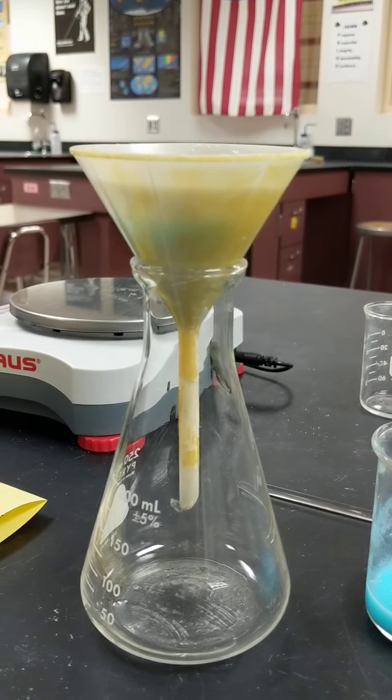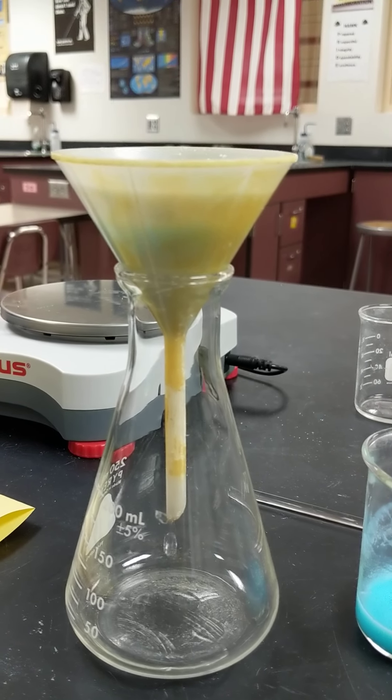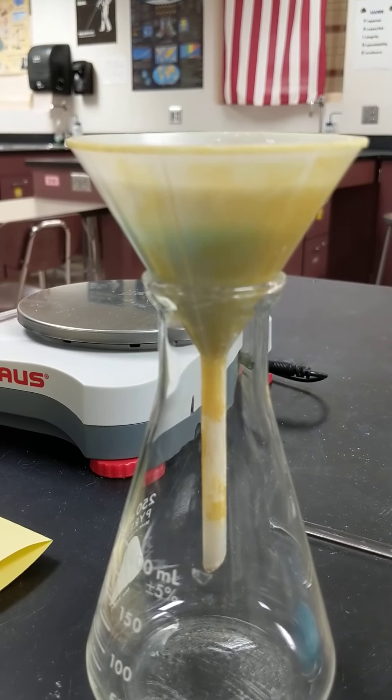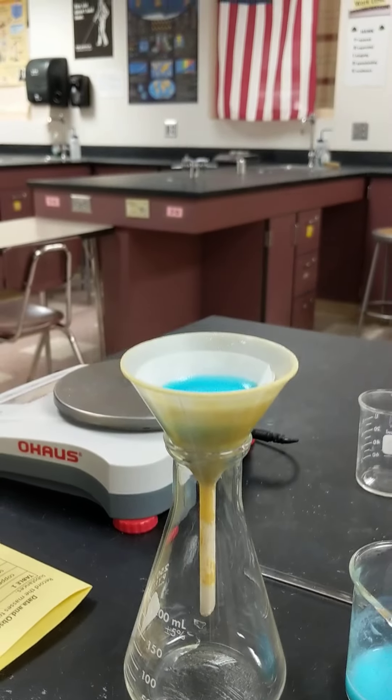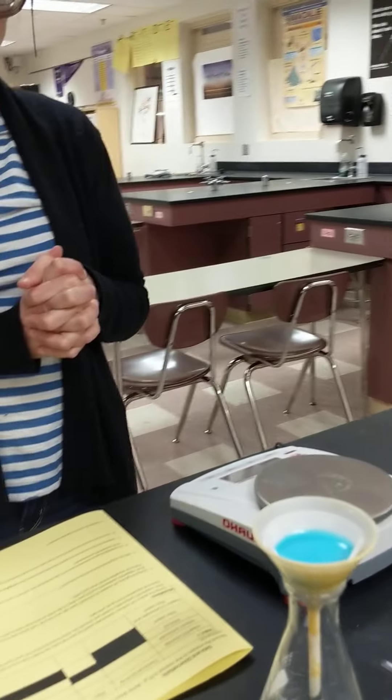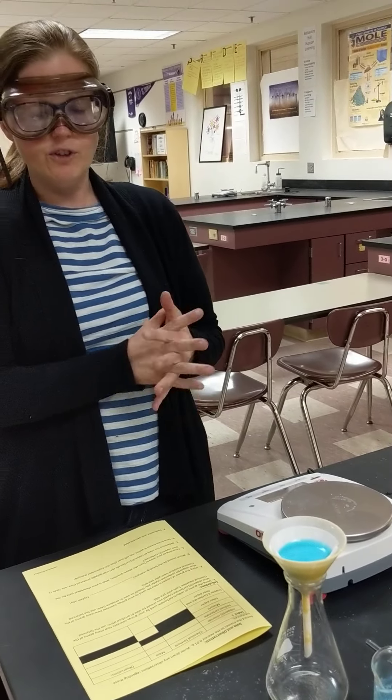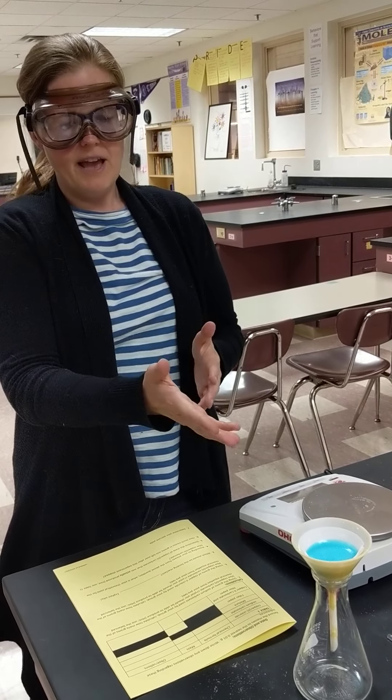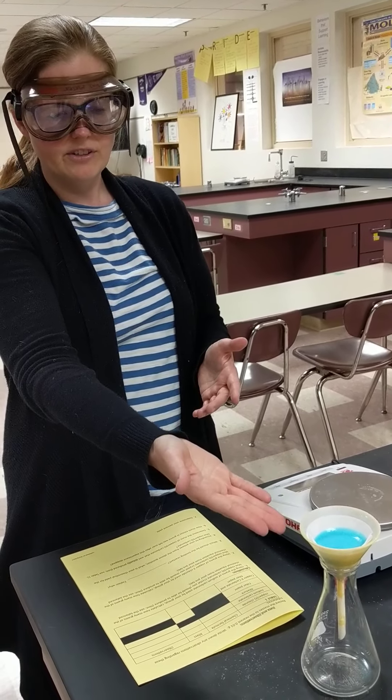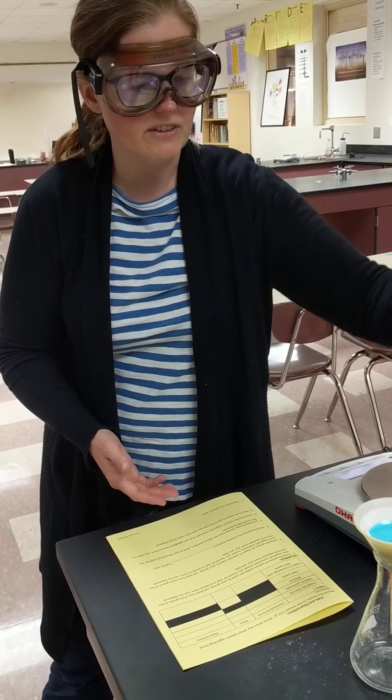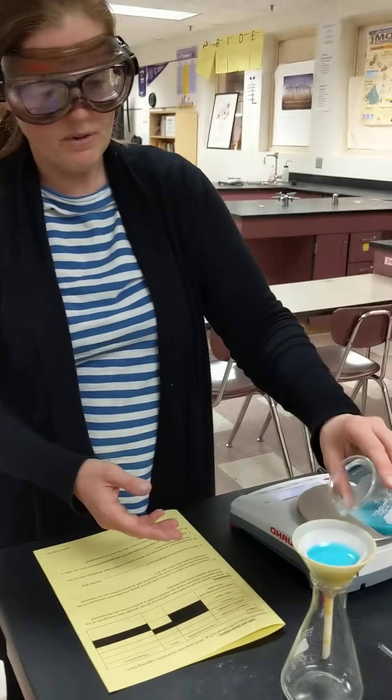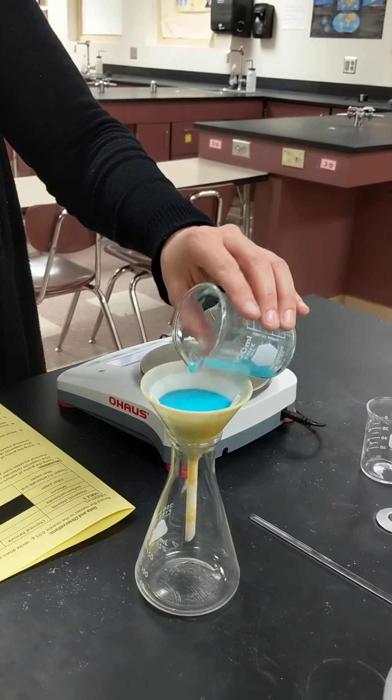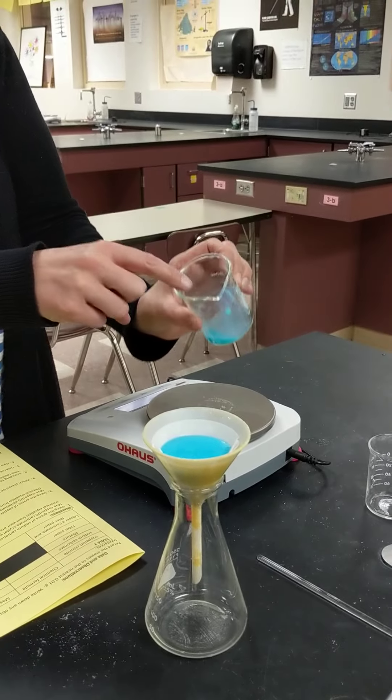But there's no blue coming out, so it's just a clear solution right there. And so that's what the in-person students are doing today. They are filtering. This is called filtering. And as this goes down, they're going to keep adding more and more of this over time. And you'll see right here that there's stuff left on the inside of that.